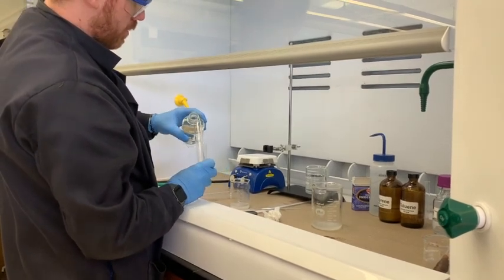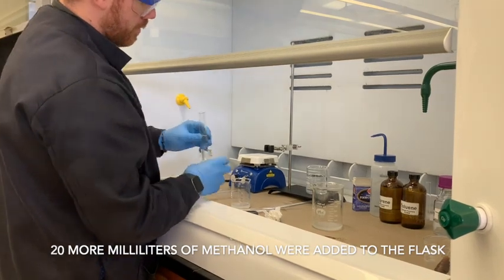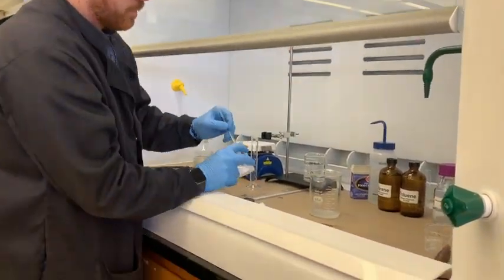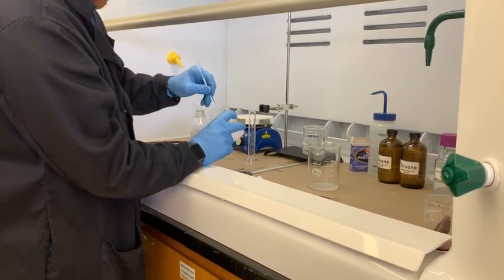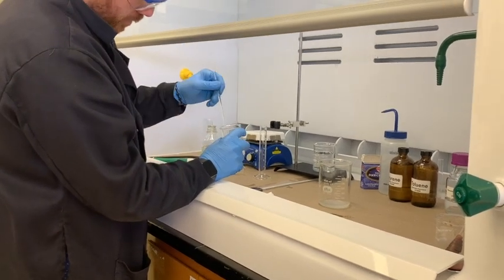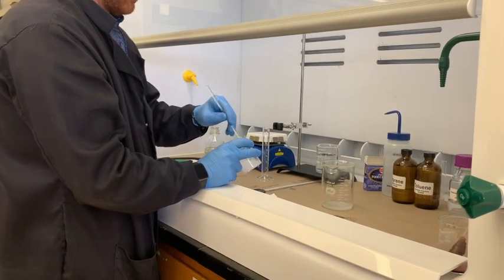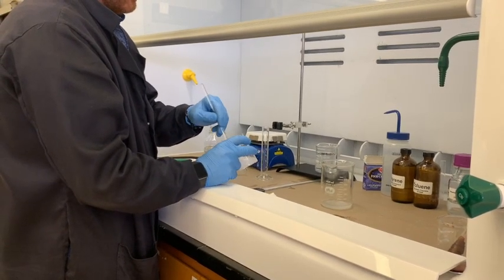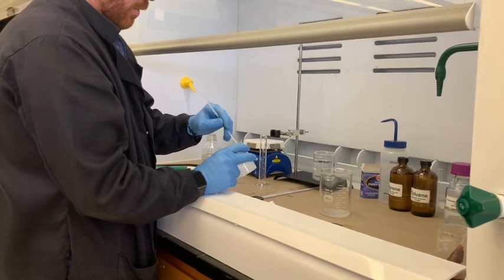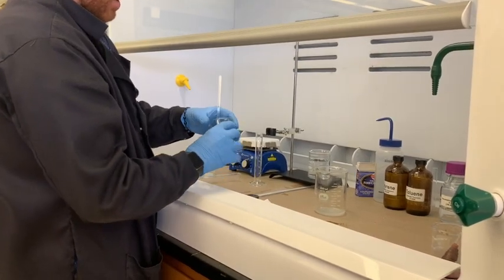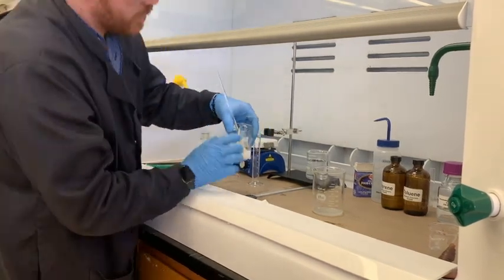I'll pour about 20 milliliters. Oh, looks like we are getting some kind of goo here. So you want to keep working at this until you start to notice the formation of that precipitate. Slow down. And then you will do your best to decant off the solution again.